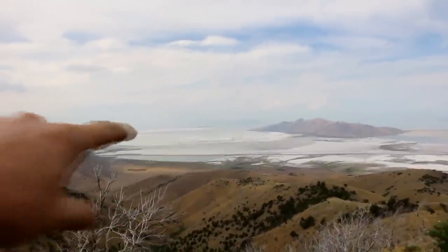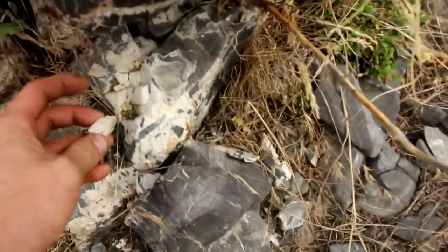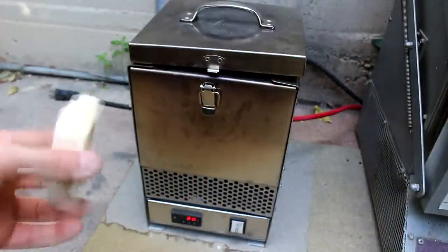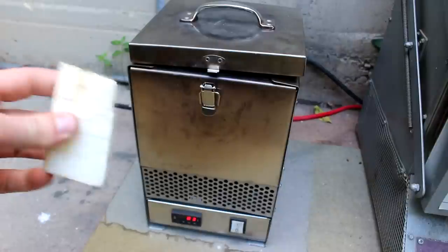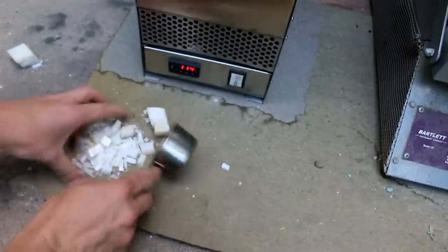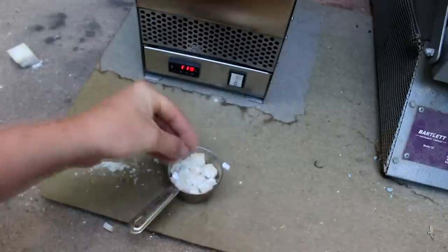There's Stansbury Island and the Great Salt Lake, and right down here some calcite crystals. Let's break a couple of these out and make a lime out of those. We need some calcium oxide, or lime, and one of the best ways to do it is to take some calcite, bust it into little pieces, and roast it using my new furnace. That's probably plenty — I don't think we're making more than about a pound of glass. Let's get this cooking.